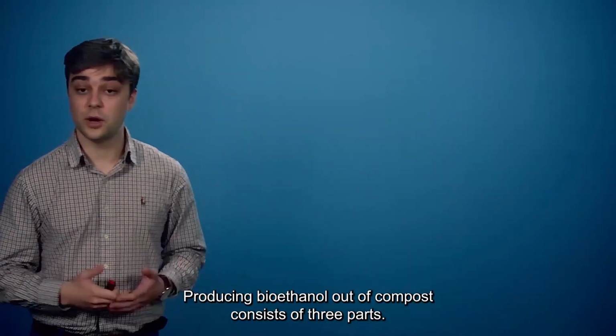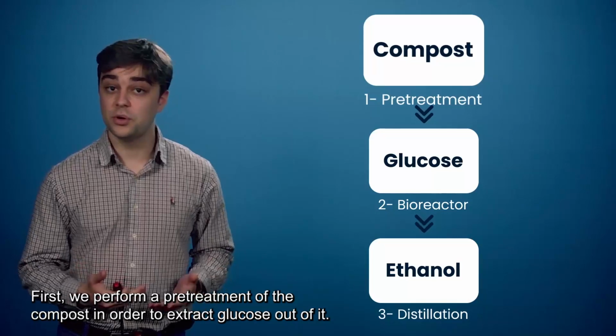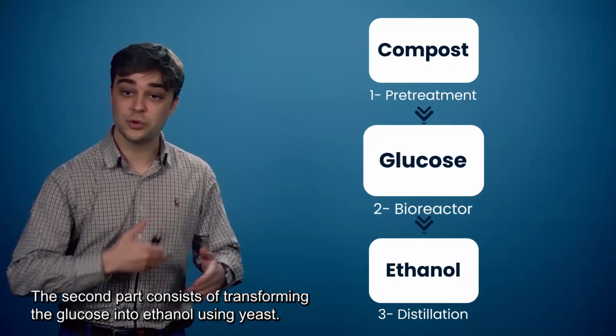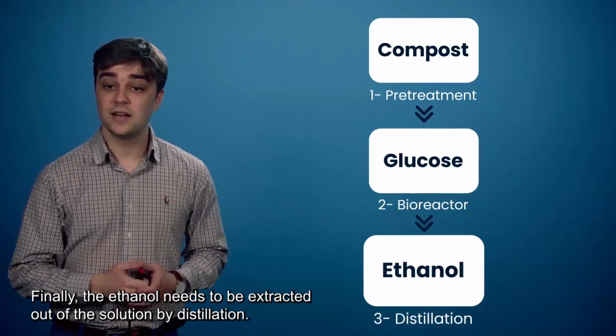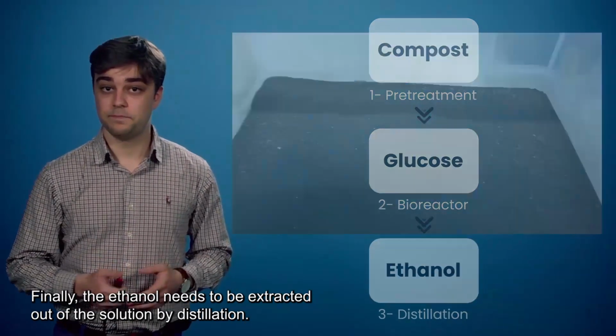Producing bioethanol out of compost consists of three parts. First, we perform a pre-treatment of the compost in order to extract glucose out of it. The second part consists of transforming the glucose into ethanol using yeast. Finally, the ethanol needs to be extracted out of the solution by distillation.